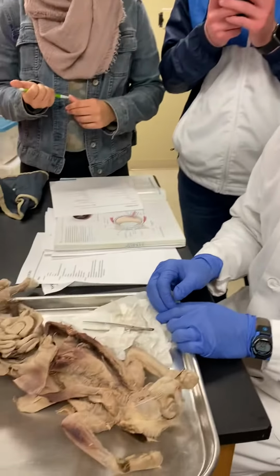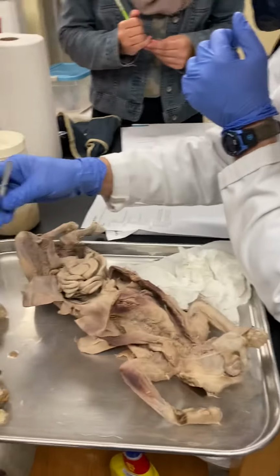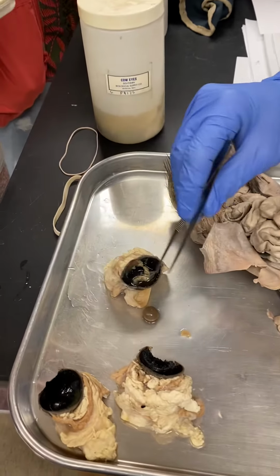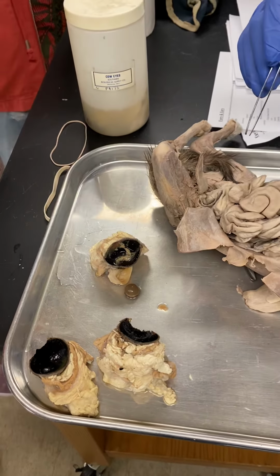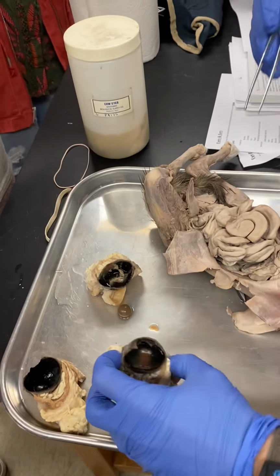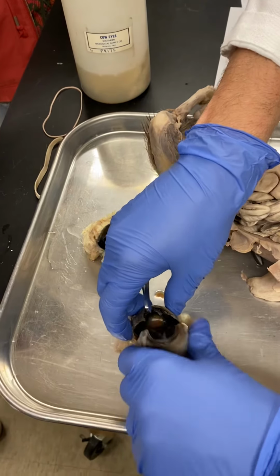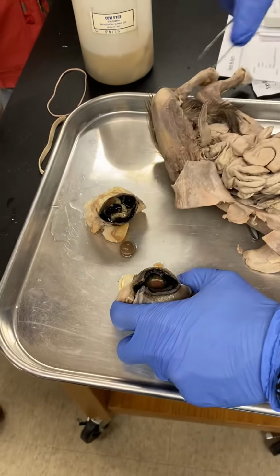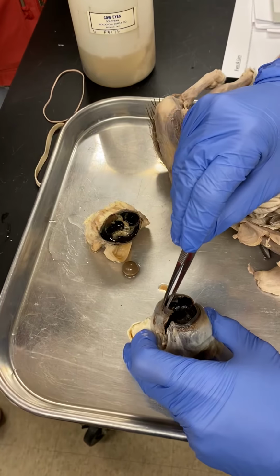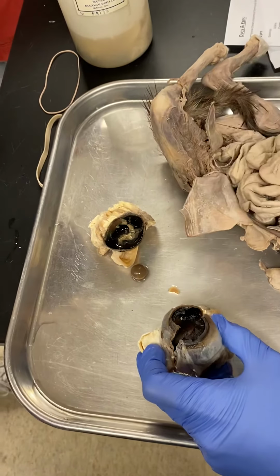All right, so we are looking at the eyes today, and what I want to showcase first is a cow eyeball here, really half a cow eyeball, and you guys need to know a couple different layers. If we start from the outside in, and imagine these two halves were one complete eyeball cut down the middle, we have the outer area, which should be transparent, that's cut away here. That would be what?